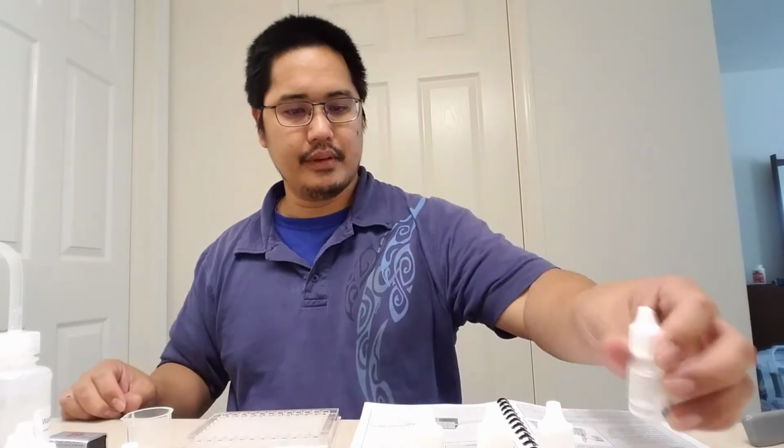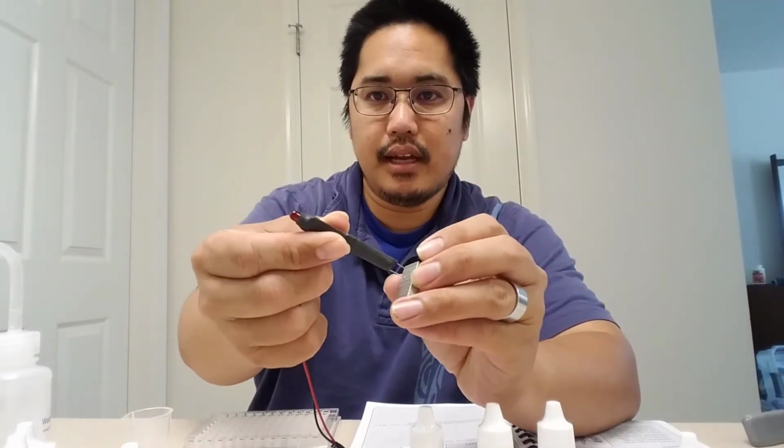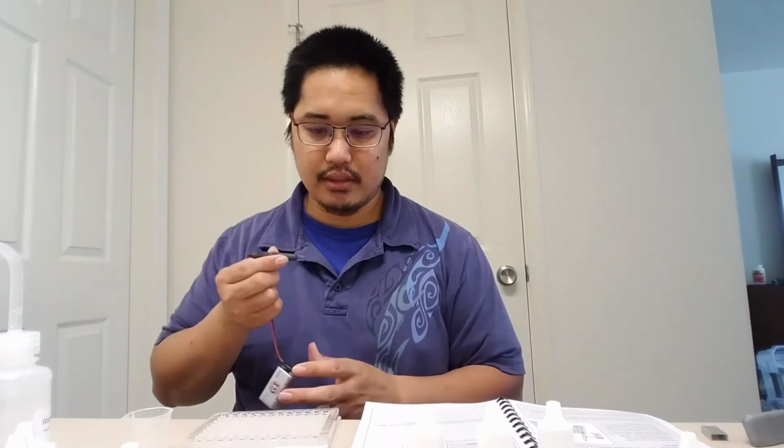Alright, now put the 9-volt battery on the battery tester, which I have, just to test it out. I have some staples, and I'm going to connect this battery tester to that. You see it lit up? That is basically 100% conductivity. So all you need to do is dip this in each slot and observe what the conductivity level is. Try to capture how bright something is, or if there's no light at all, or if it's really, really bright or dim. I know that's not necessarily the most scientific scale, but I guess you can decide on what happens.